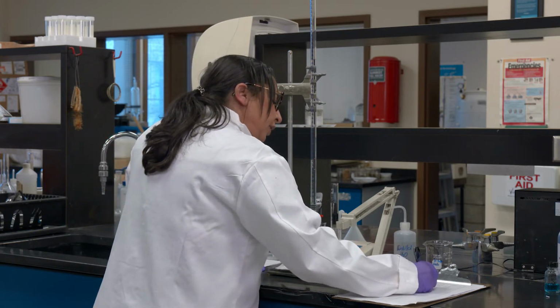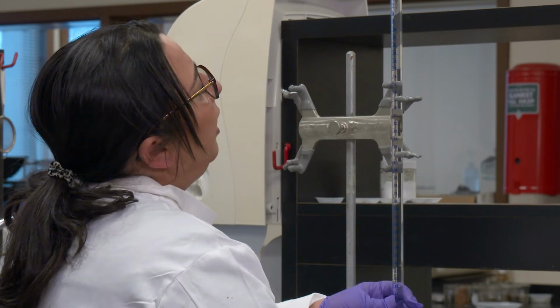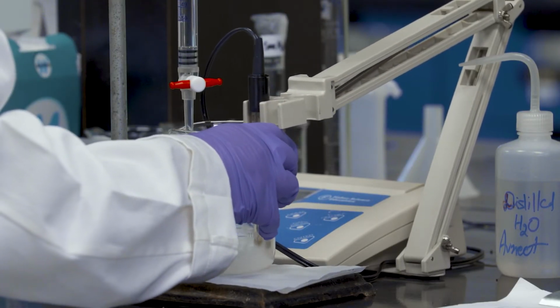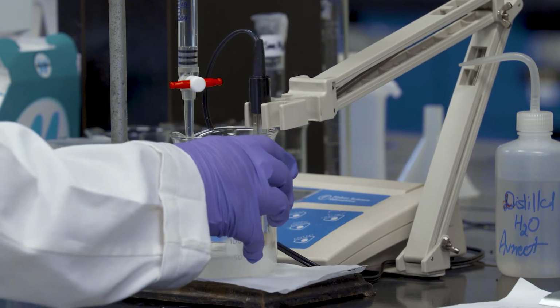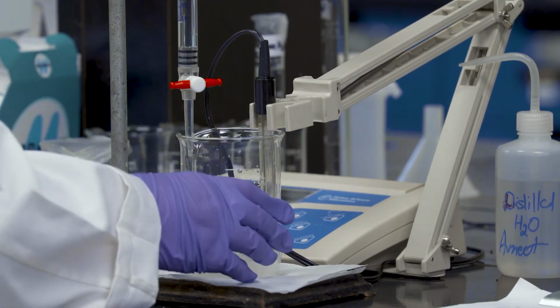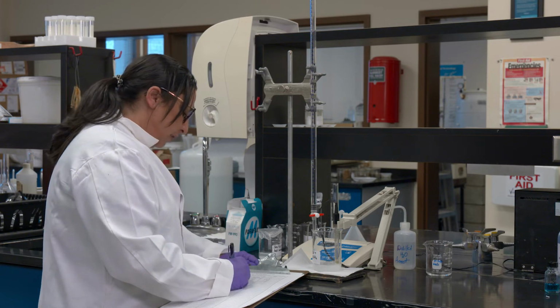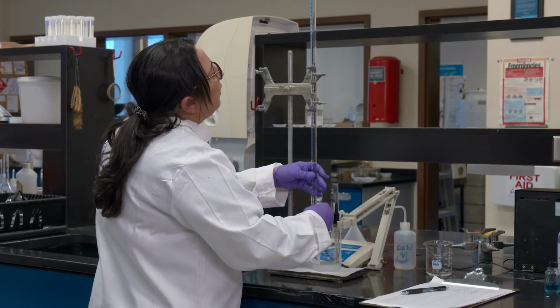Okay, so let's continue adding some more and more, and I will show you when there will be a change in color from being cloudy to a little bit more clear. Just be very, very careful as you're adding the acid into your solution while stirring. Avoid taking those splashes on yourself, because now this is becoming more and more acidic. So I'm just going to let it rest, and I'm going to wait for my pH meter to give me the reading. Yes, so we jumped down from 9.5 to 9.41, still cloudy. Let's see when it hits the equivalence point.